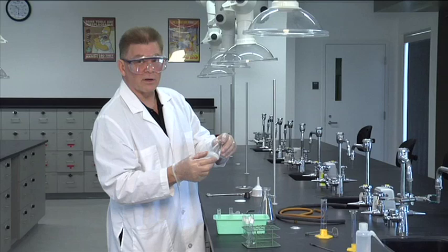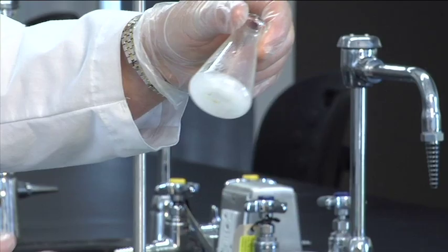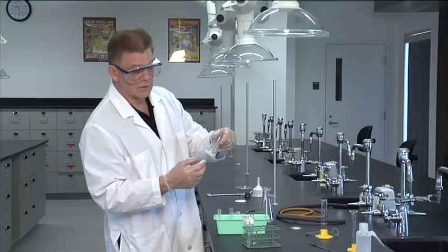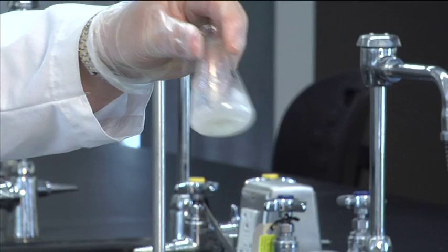Here was our flask of the benzoic acid, and wow, it's almost a total chunk of crystals. Awesome. I'm going to break it up a little bit.